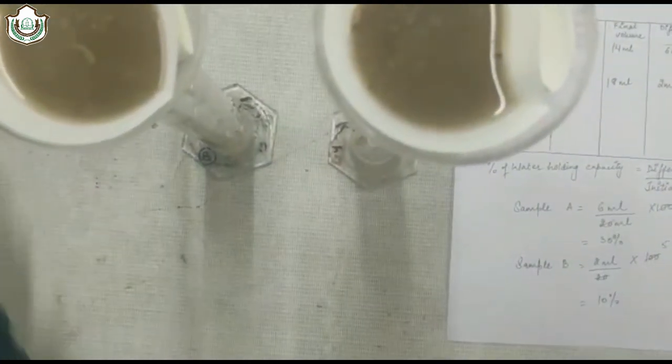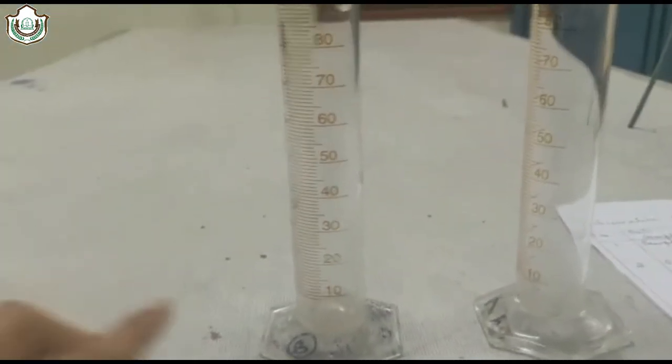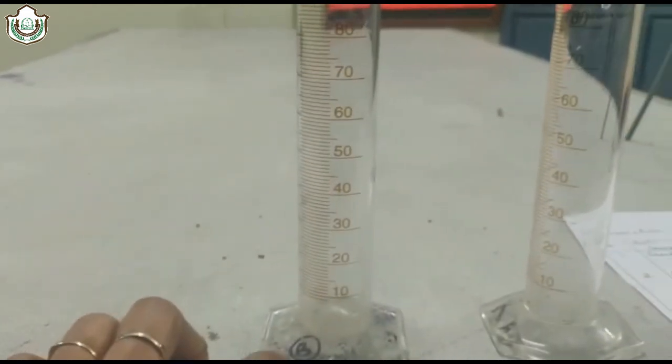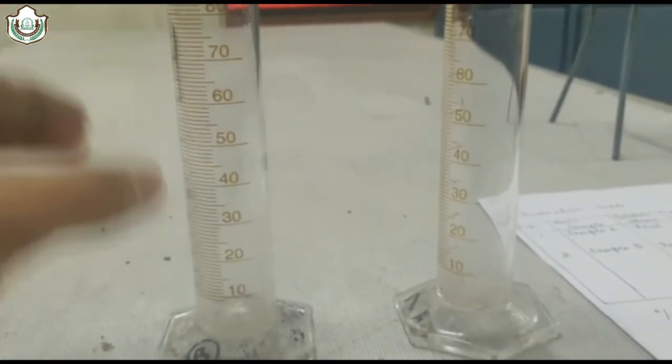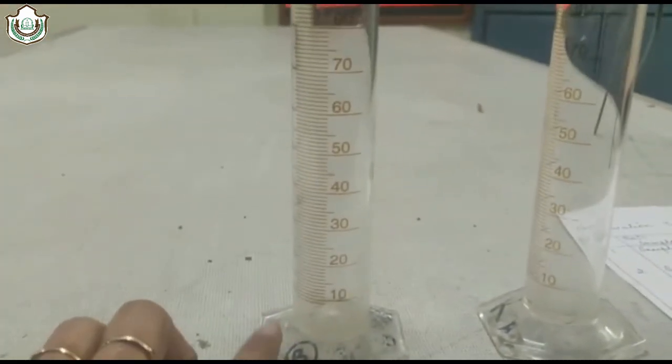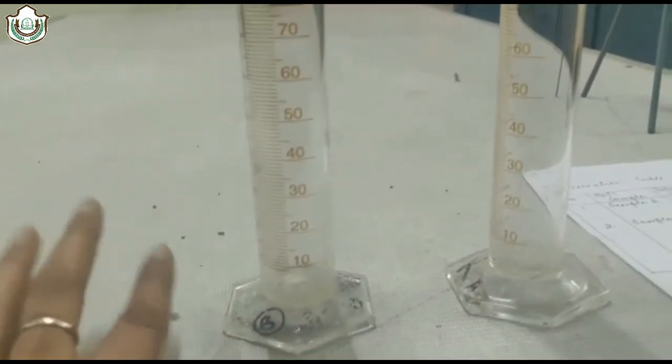After some time, you will see the water collected at the bottom of the measuring cylinder. When all the water will collect in the bottom of the measuring cylinder, you have to measure it.